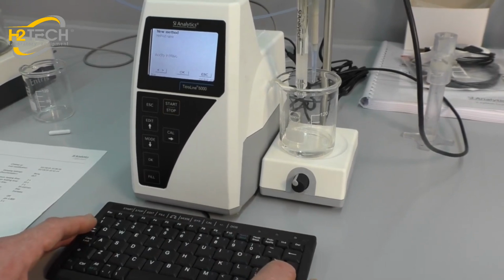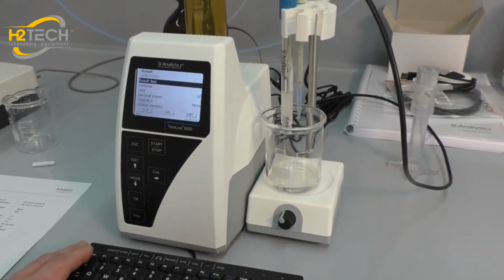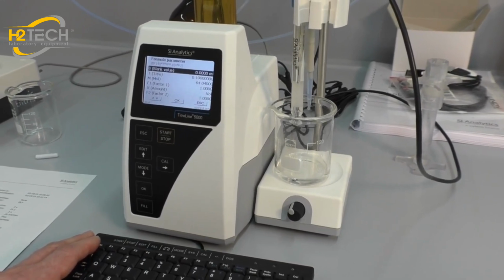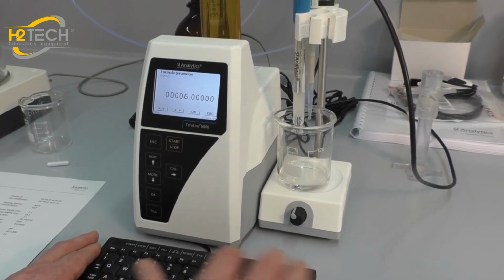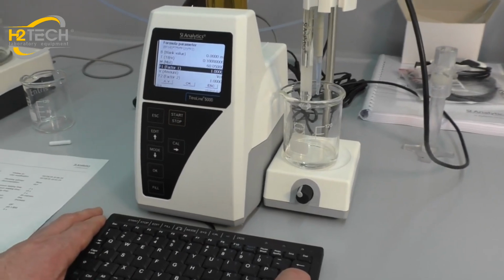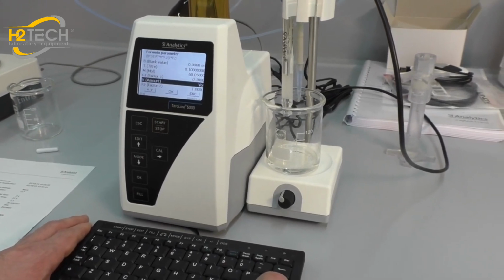Okay, fine. Next step is we have to change the result calculation, because the acidity is fine, but the formula has to be changed a little bit. Now we have the equivalent weight from citric acid here, and we will have to change it to the molecular weight of acetic acid. The factor has to be changed, because now we want to calculate in percentage, and percentage means gram per 100 gram.